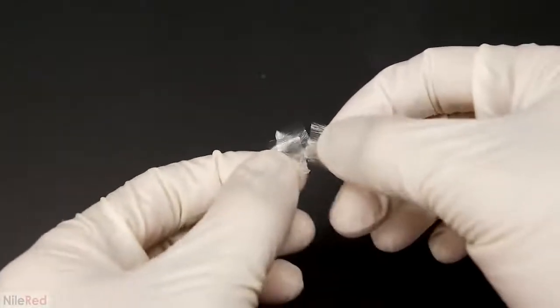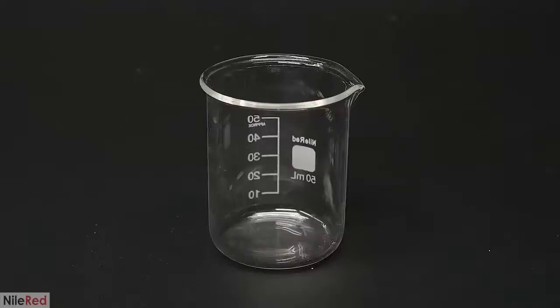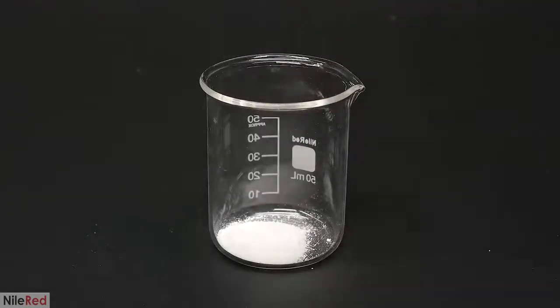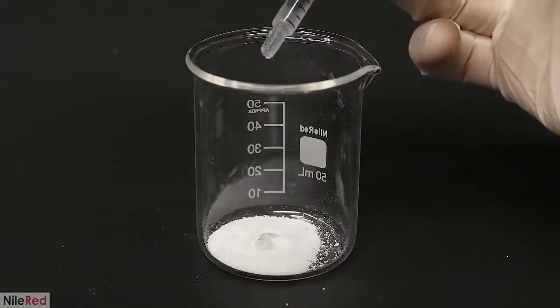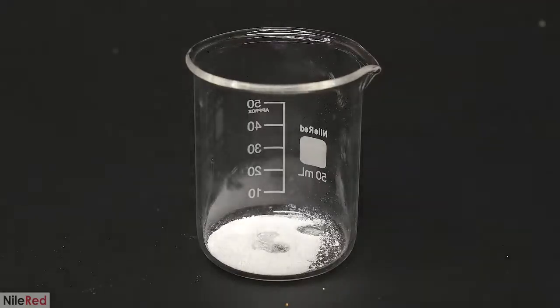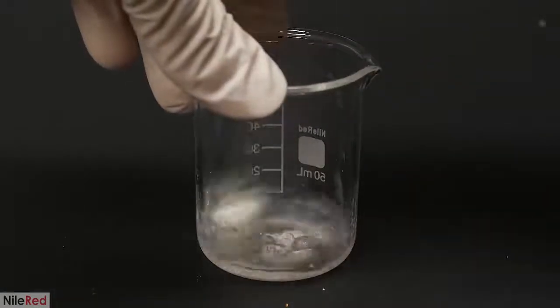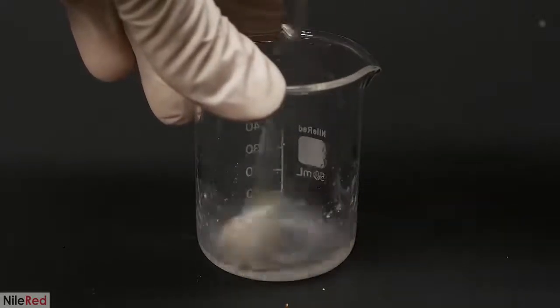Anyway, what I wanted to try next was to see if I could make the plastic less brittle by adding a plasticizer. The phthalate-based plasticizers are the most commonly used ones, but unfortunately I didn't have any. I was able to find a paper though that talked about replacing the phthalates with triacetin, which is something that I have. The triacetin is an acetylated version of glycerol, and it's a lot more environmentally friendly. The paper talked about a couple different plasticizer ratios that could be used, but I decided to go with 20%. I went with 20 because it seemed to offer a good combination of strength as well as flexibility.